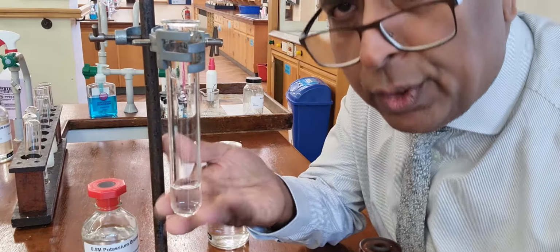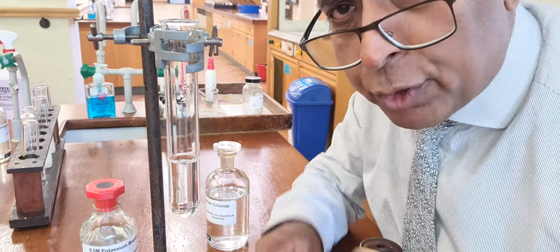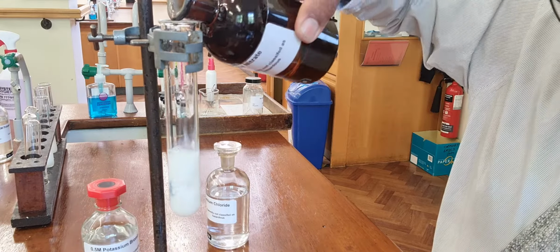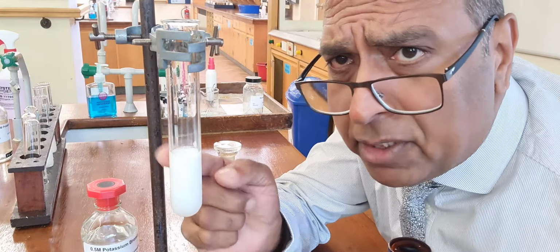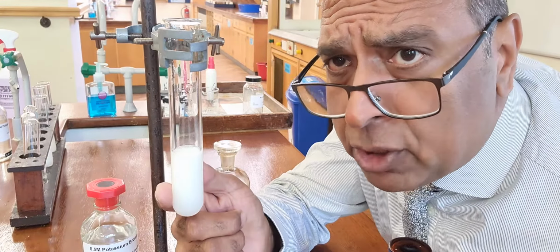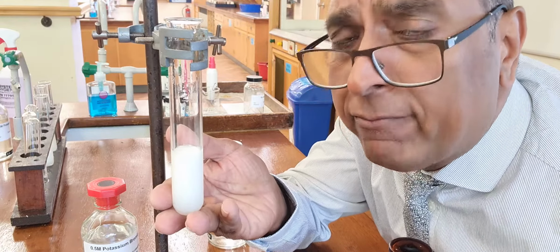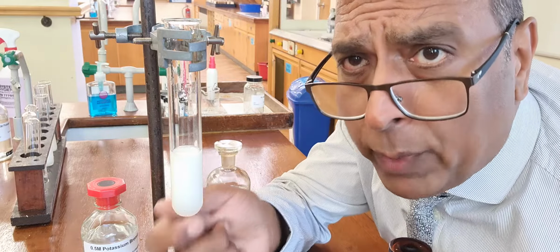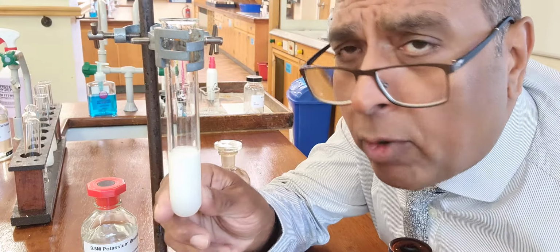So this is where we think we got bromide. Yeah, think we got bromide. Add acid to stop any false positive tests, and then silver nitrate gives you a cream. Now you might not see that on the video, but this is a cream colour. Cream as opposed to white. So white for chloride, cream for bromide. So this is silver bromide. What we had before was silver chloride. Silver chloride is white, silver bromide is cream.